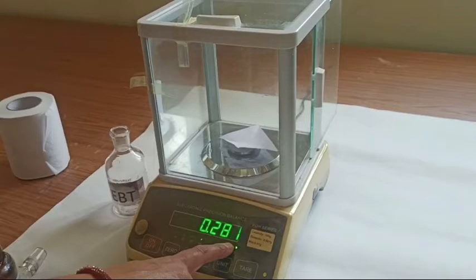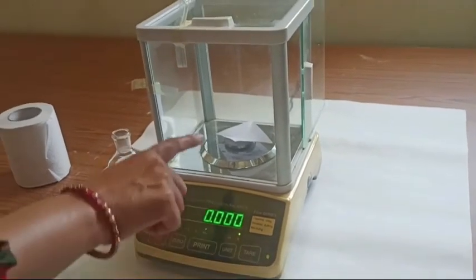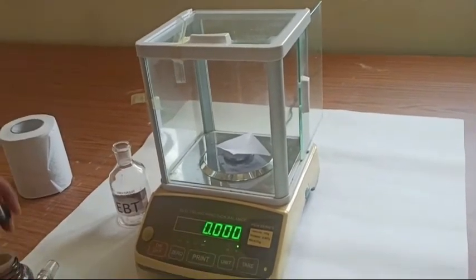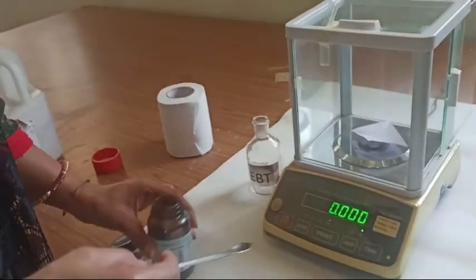But here is the facility which is given over here is tare. So that the weight of this paper becomes zero. And we need not add or subtract anything from this. We simply get weight of the sample.